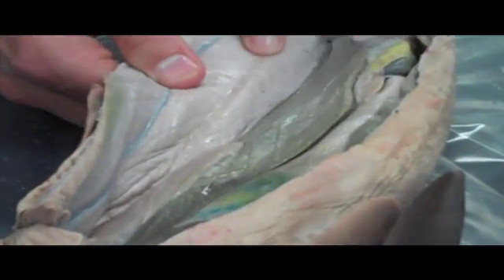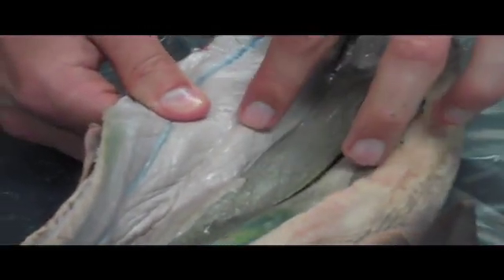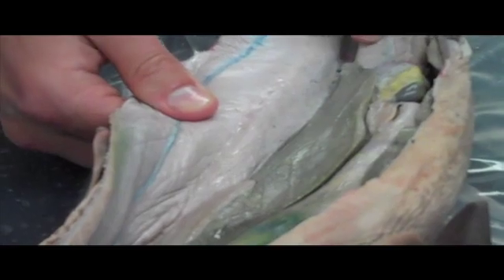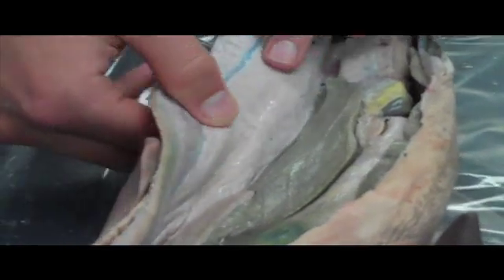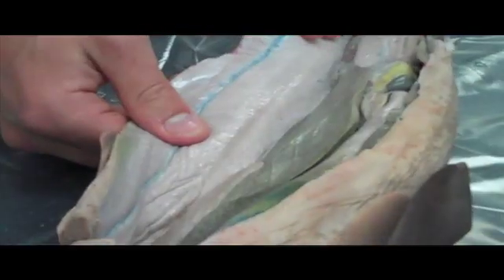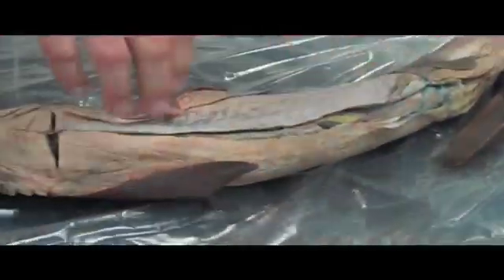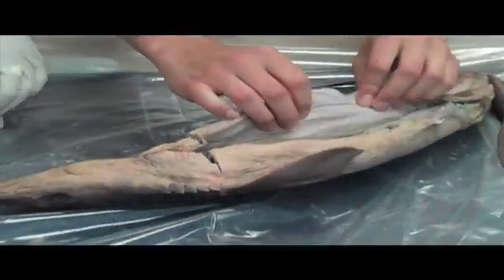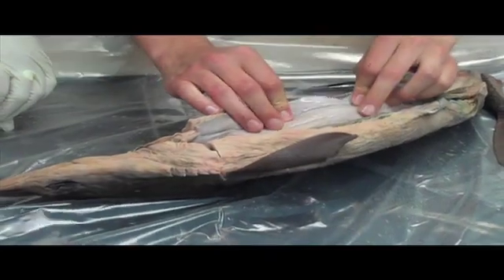Here you can see it really well. These different segments are all different muscles that can be controlled individually. And so if this were not the case — if it was just one mass of muscle — then the shark would only go back and forth and back and forth. But with the different segments it has a lot more control.